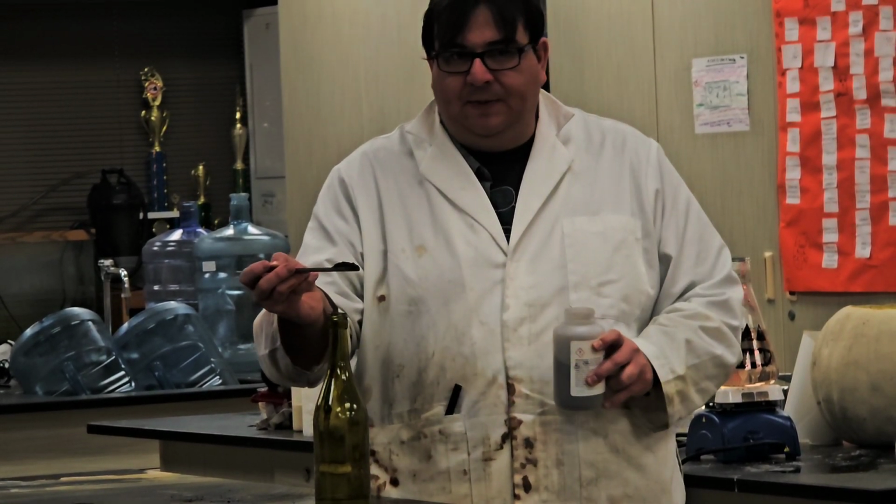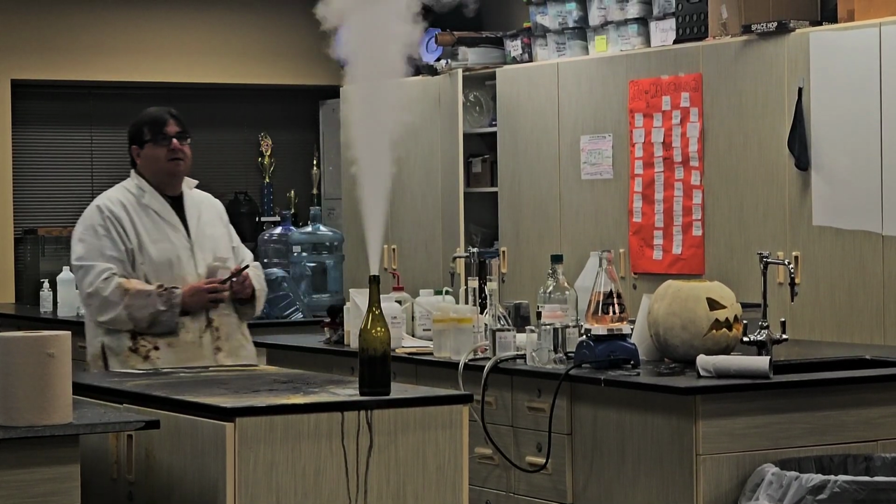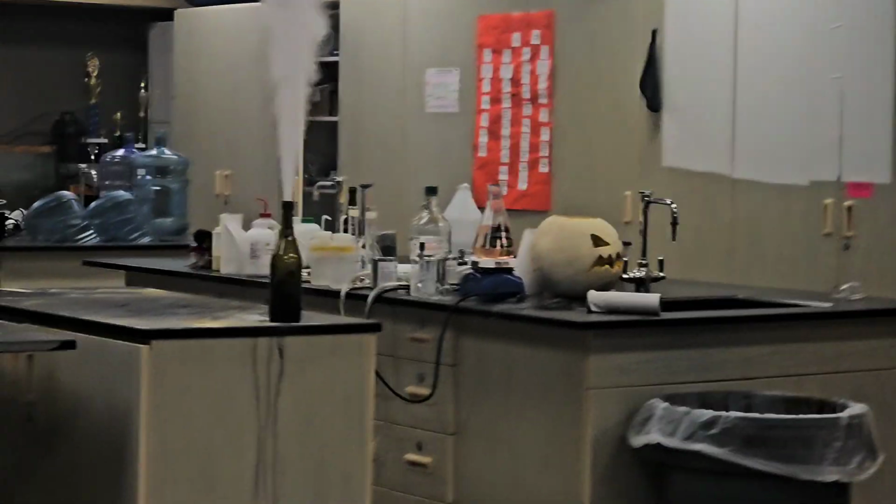You guys are going to have to come up here and smell this. Come up, smell it. Smell it.